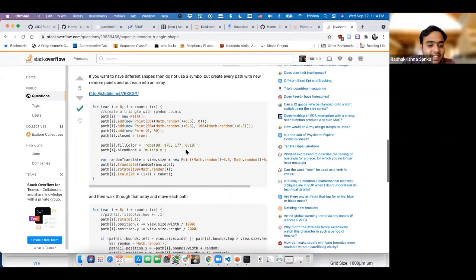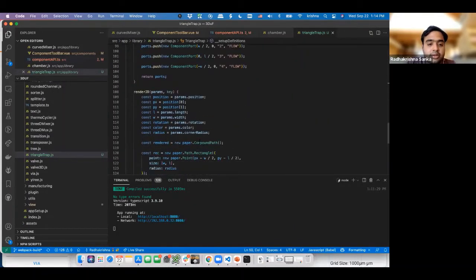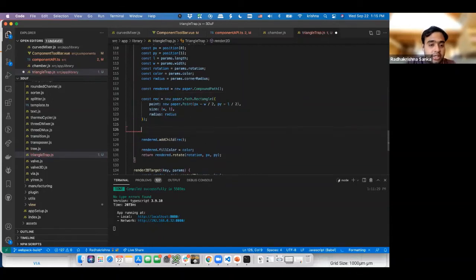I don't really want to copy this particular triangle code, but it does a job at some level. So we're going to take this entire code over here, and I'm going to copy this. Now I'm going to go into my code for the triangle trap definition here. I'm going to go where I need to do the render 2D. Render 2D is basically the code that generates the whole thing. As you can see over here, all we are doing is drawing a rectangle with a certain width and length and those kind of parameters. So we created the rectangle over here. I'm going to add the triangle and subtract it from the original rectangle. The const triangle.